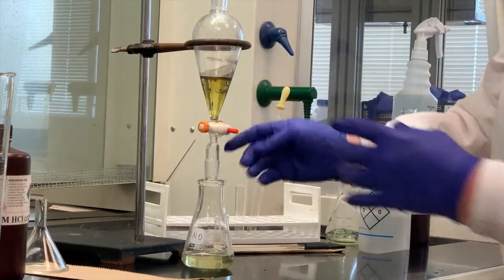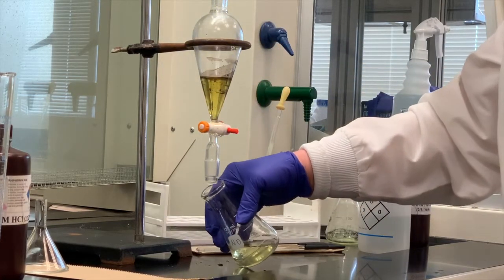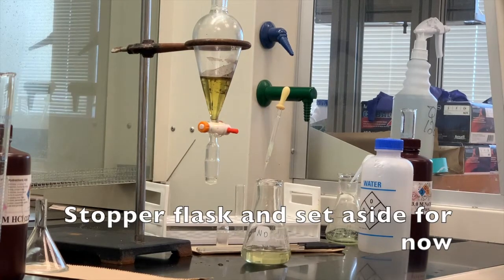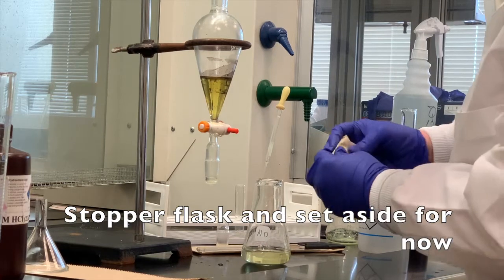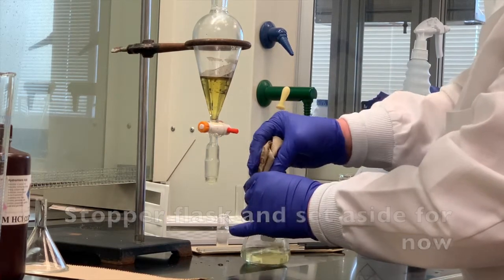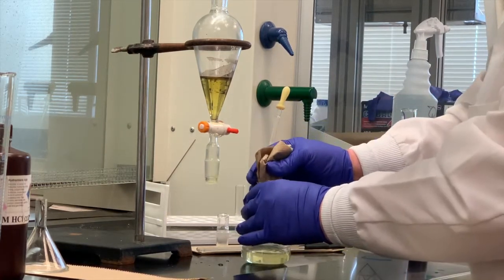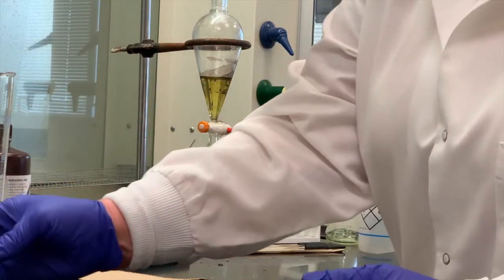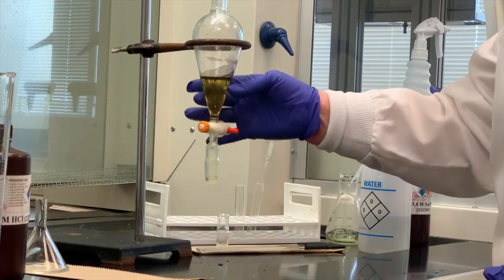I'm going to stop it there. Now, since that does have methylene chloride in it, I'm just going to stopper that loosely until I'm ready for it again. But remember, the NO is referring to my neutral organic. The O stands for organic, so I'm going to move it to the side. And what I want to do is collect this material.